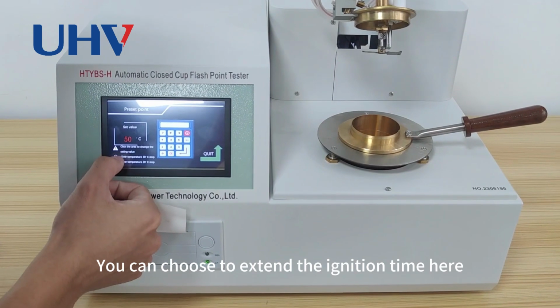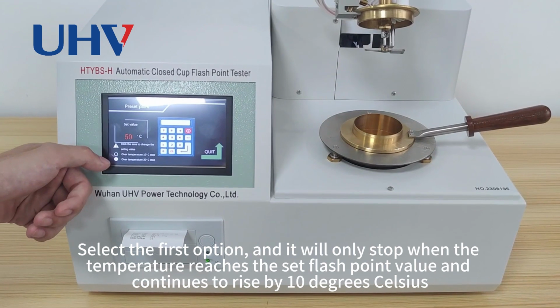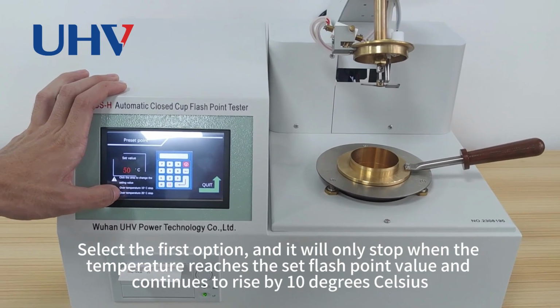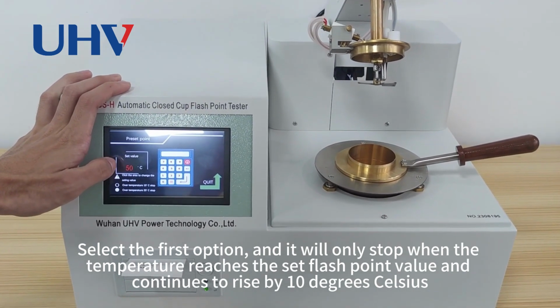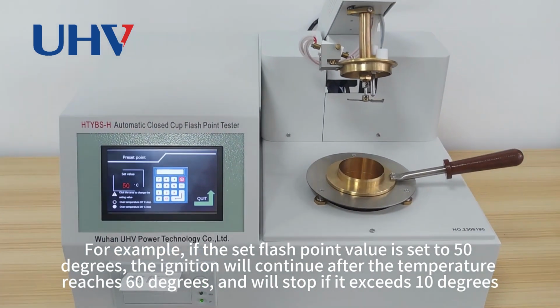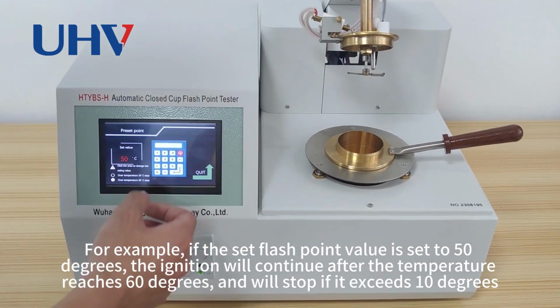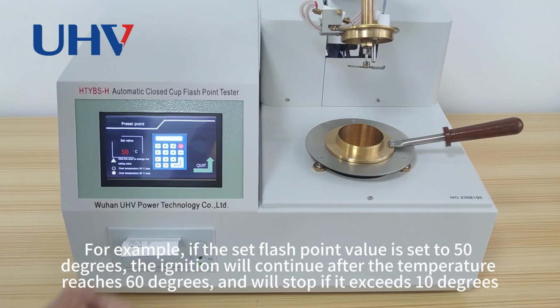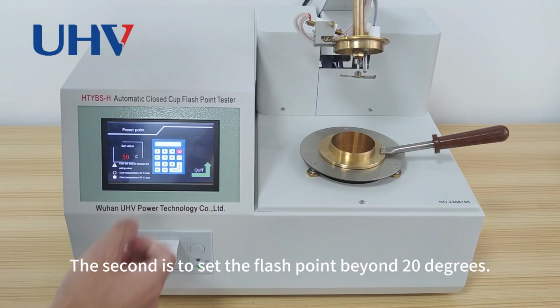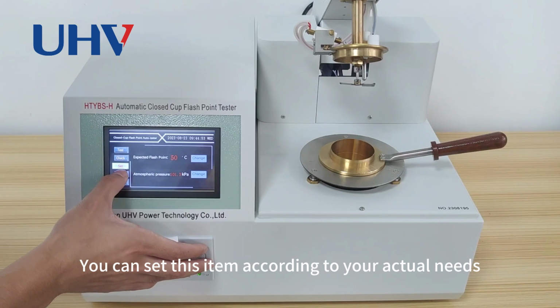You can choose to extend the ignition time here. Select the first option and it will only stop when the temperature reaches the set flash point value and continues to rise by 10 degrees Celsius. For example, if the set flash point value is 50 degrees, the ignition will continue after the temperature reaches 60 degrees and will stop if it exceeds by 10 degrees. The second is to set the flash point beyond 20 degrees. You can set this item according to your actual needs.